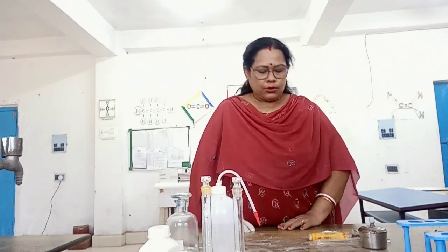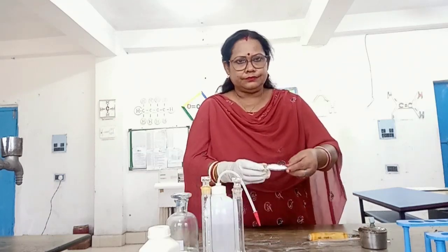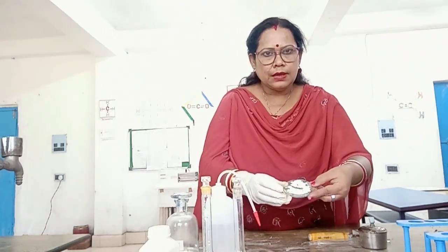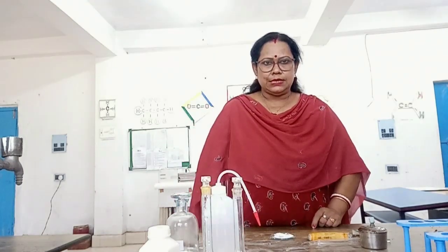Dear students, today I will show you how to test lead ions from a given salt. Lead belongs to group number one of salt analysis. It is white in color and soluble in water.